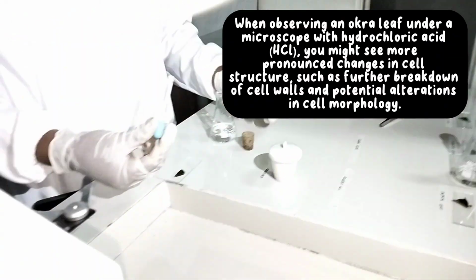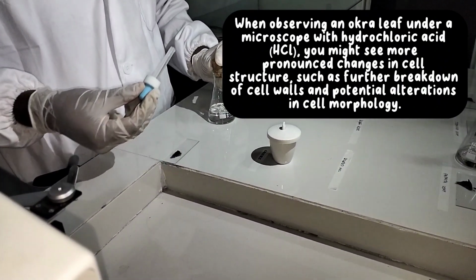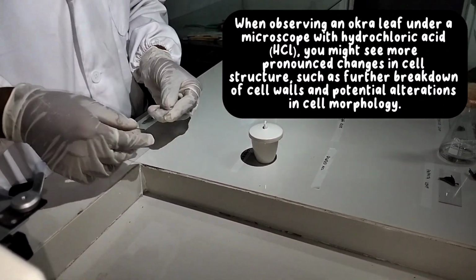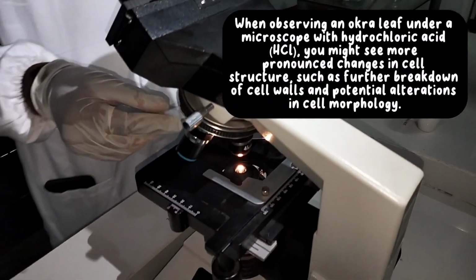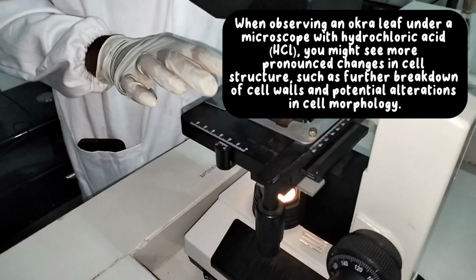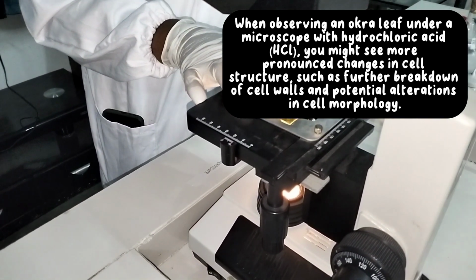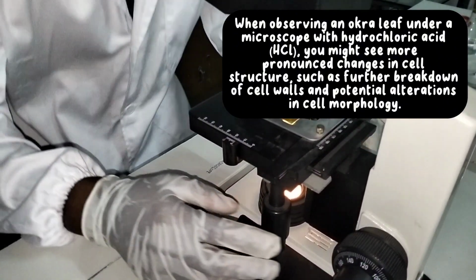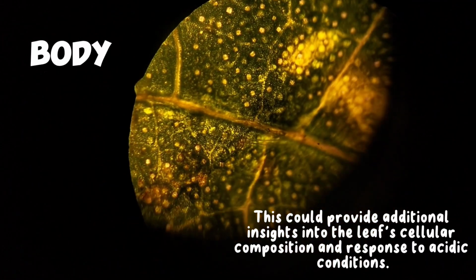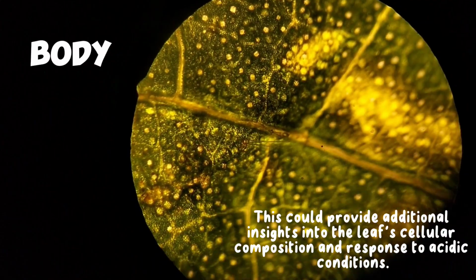When observing an okra leaf under a microscope with hydrochloric acid, HCl, you might see more pronounced changes in cell structure, such as further breakdown of cell walls and potential alterations in cell morphology. This could provide additional insights into the leaf's cellular composition and response to acidic conditions.